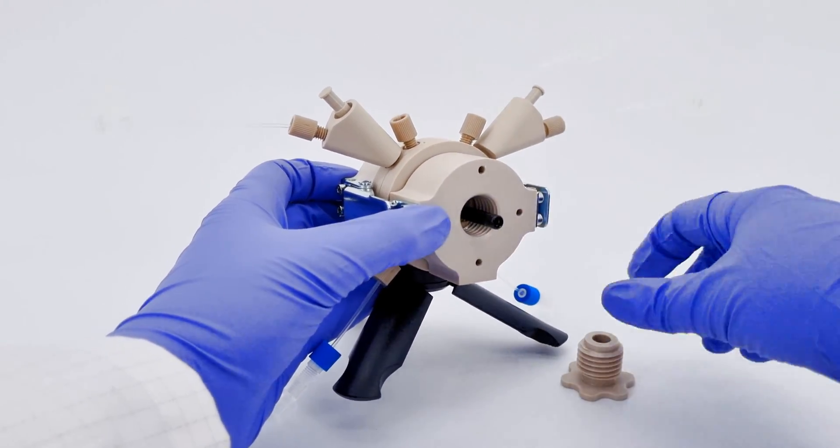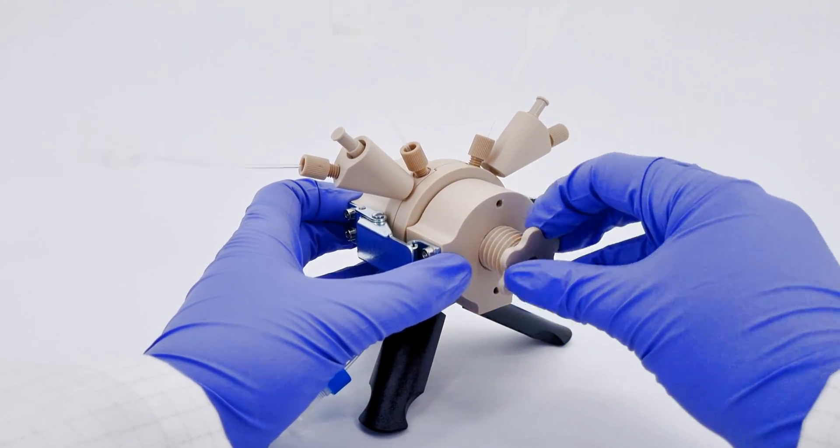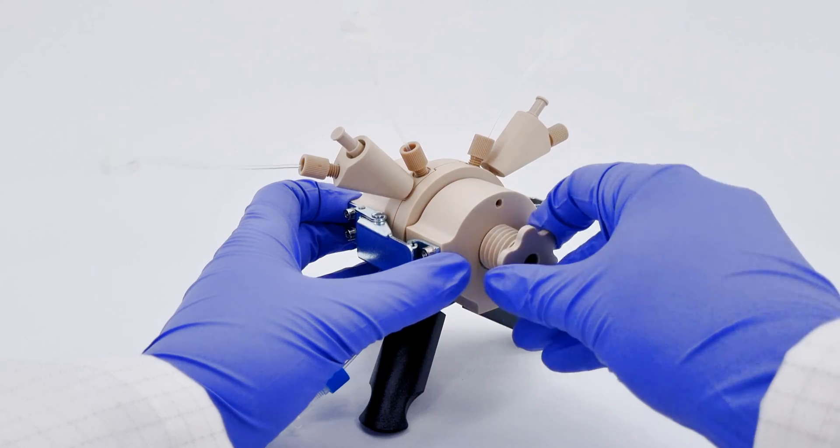Let's slide the piston back in and re-tighten the screw mount. This will ensure our electrode is snug and secure.